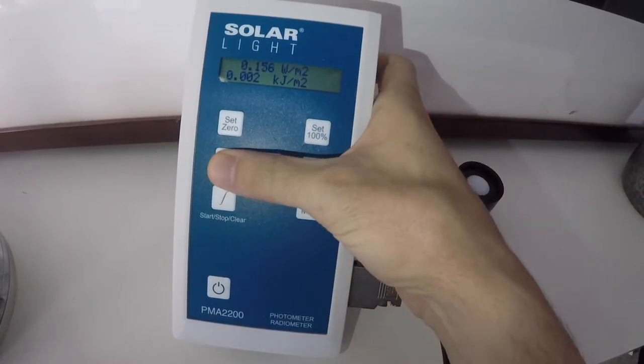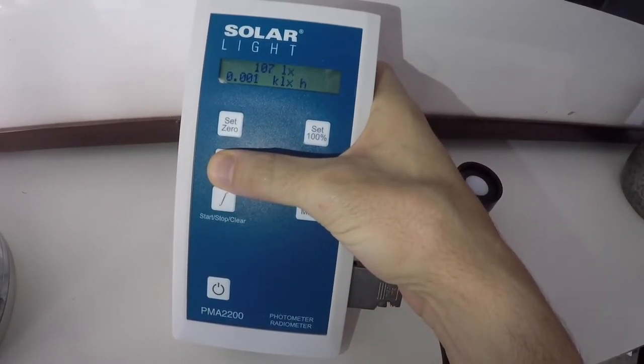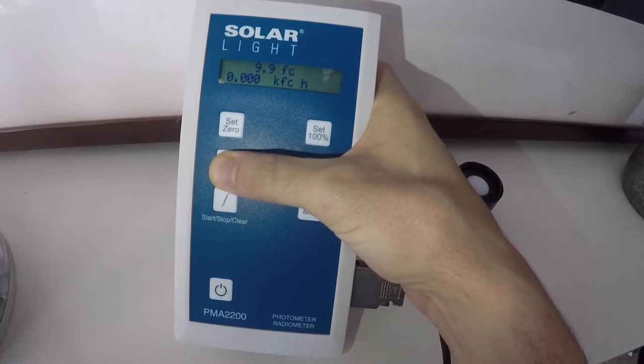If I switch my Units while I do this, I can switch between all the available units I once had and see the Dose and the different representations.